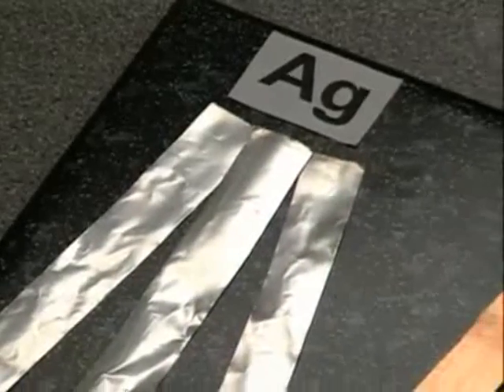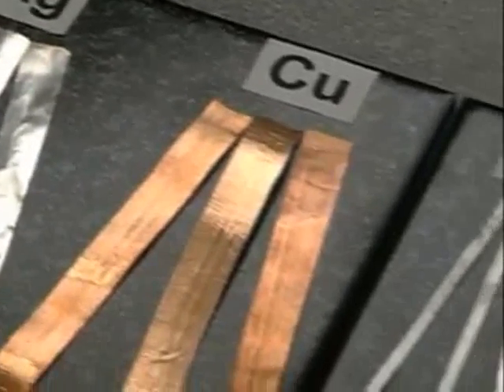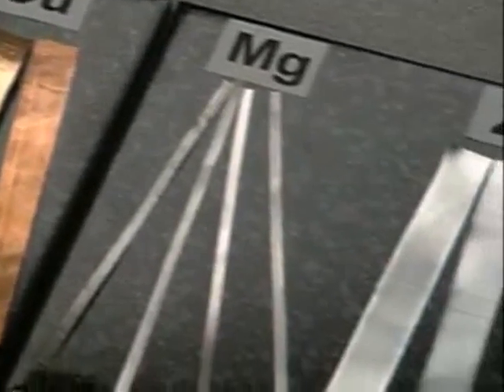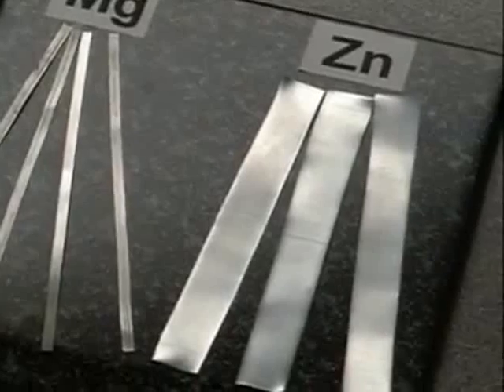But there's a wide range of metals in between and seeing how they behave in different solutions can help put them in order of reactivity.